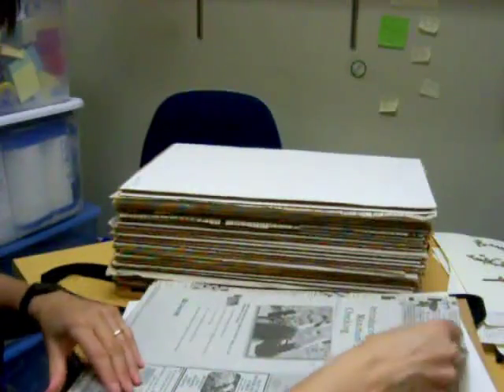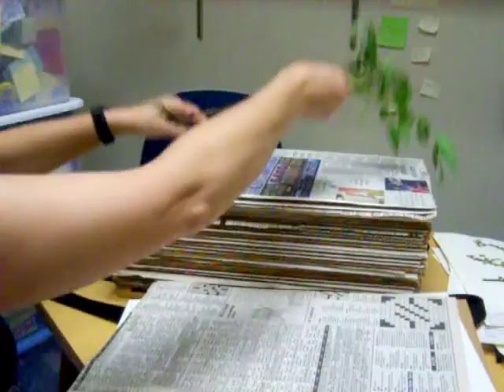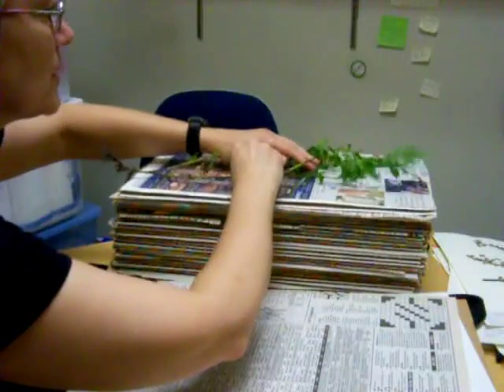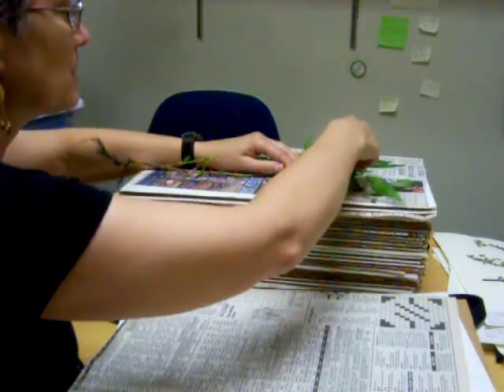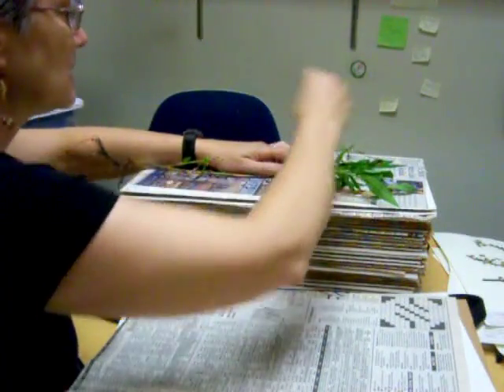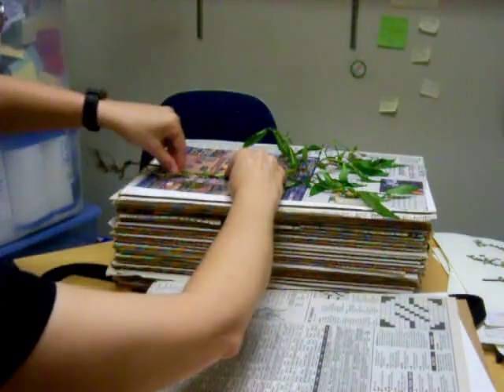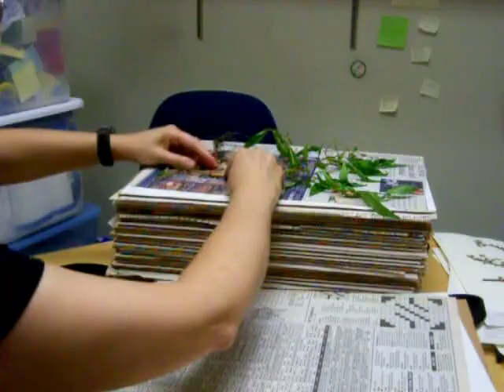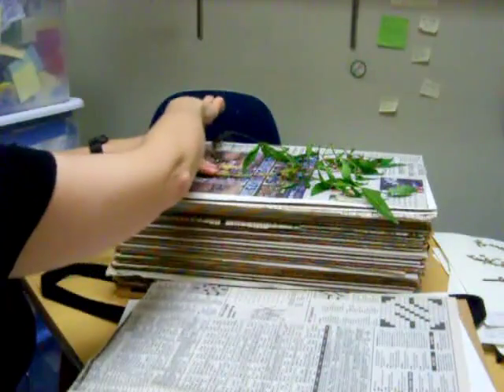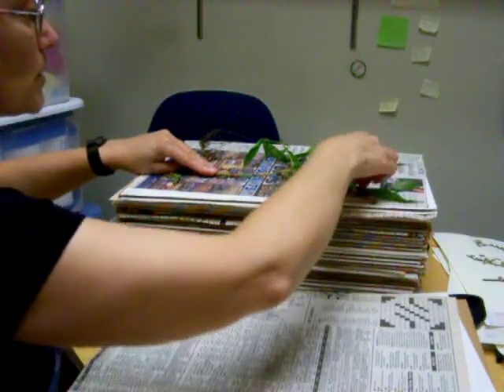Then I build my sandwich some more. Now this second specimen is going to be more of a challenge because there's a lot more greenery, and it just may not be possible to get every leaf independent. I would take more of the soil off if I were actually going to mount it. I need to bend this stem up, and keep in mind that we're going to need to put a label down in the corner, so you want to arrange the plant so there's going to be room for that.